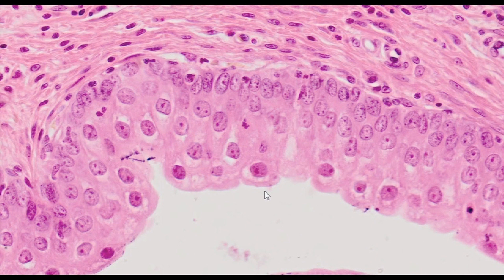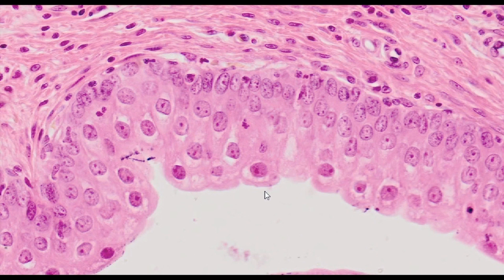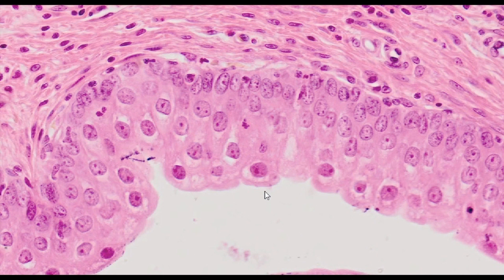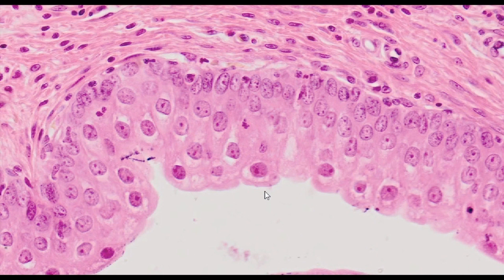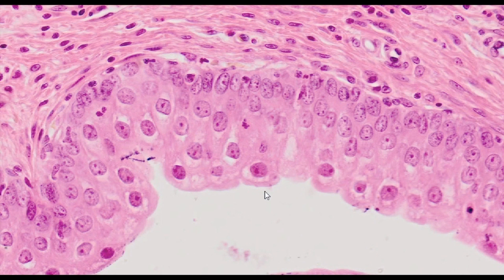The cell membrane of the apical surface of umbrella cells has thickenings made of proteins called uroplakins, which are a hallmark of this site. This is a group of proteins that form plaques covering about 90% of the epithelial surface.